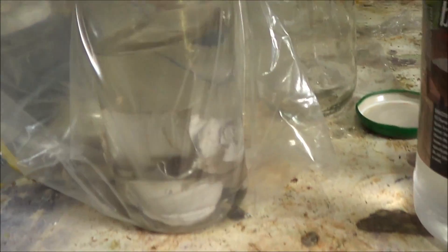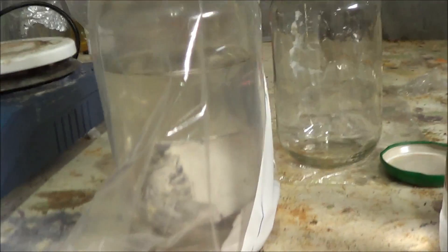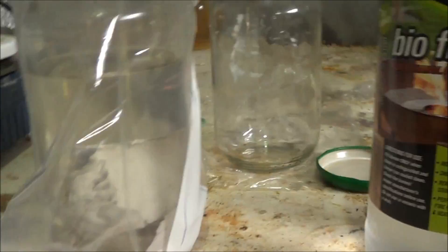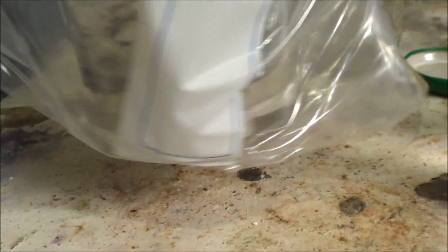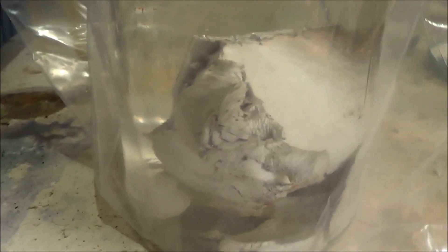And we're going to be reacting with this sodium. This is the first time I think I'm going to use the sodium metal for an experiment that isn't just ditching it in water and watching it explode. So this is a nice thing. This is about half of what was left of the 100 grams, so 50 grams. You can see in there is the metal casing. It's actually really difficult getting it out of the metal casing. I didn't think it would be so difficult, but it was because it's really soft. You can't like pry it out with a screwdriver. It's formed a bit of a white coating. You can sort of see that because there's obviously a bit of water in the air and stuff that's leeched through in the few months since I've opened this jar. And so it's got a bit of hydroxide coating.